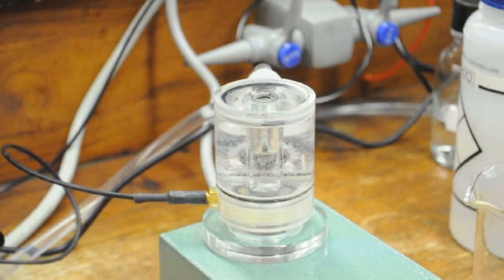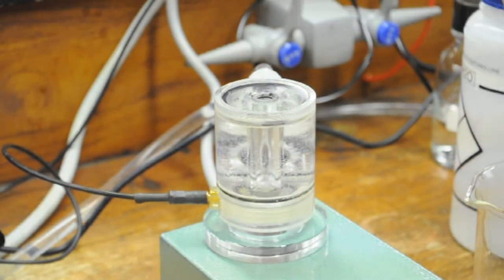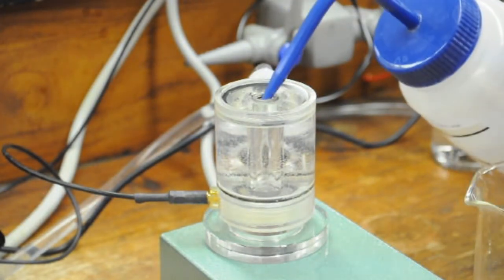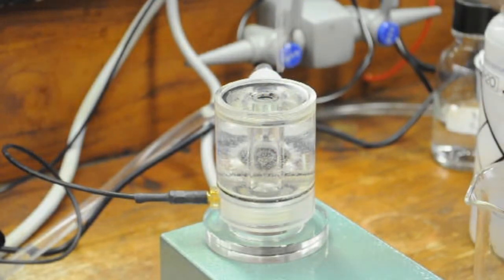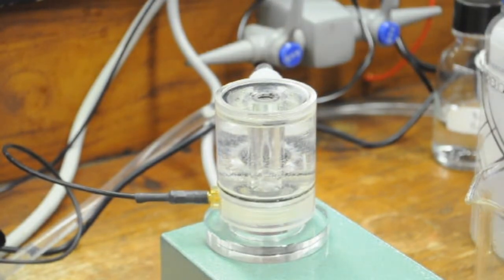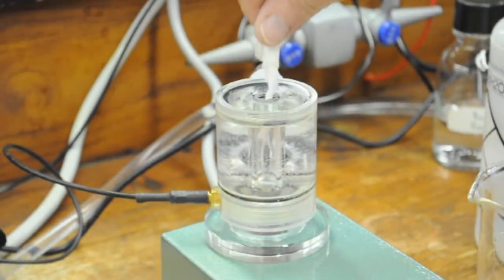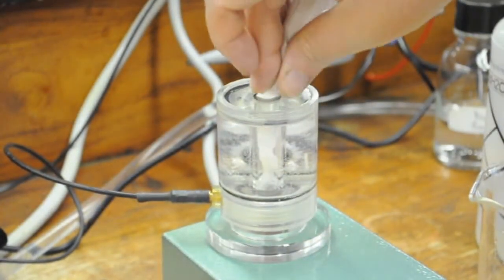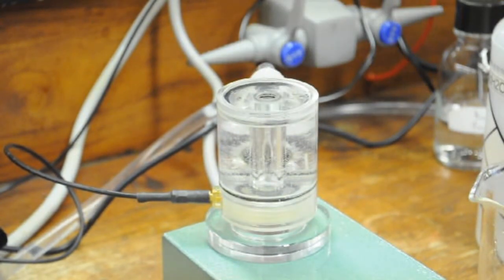Before starting an experiment you must completely remove the solution in the cuvette. In this case if we don't completely remove the dithionite it will interfere with our experiment. Remove the solution using the modified Pasteur pipette and then refill the cuvette with water. Repeat this at least three times. To remove the last bit of water before starting your experiment use a twisted Kimwipe to blot out the bottom of the cuvette. Note that if you are not ready to immediately add your sample you need to leave some water in the cuvette so the electrode does not dry out.